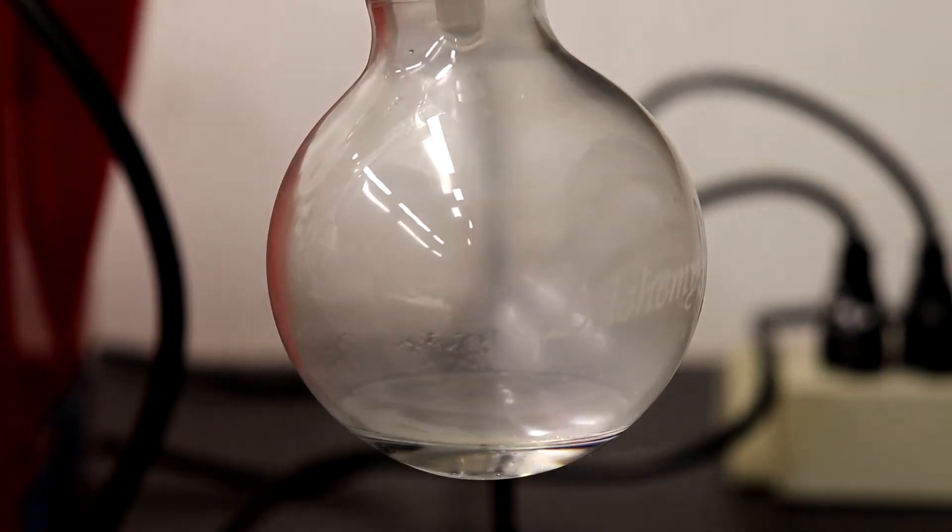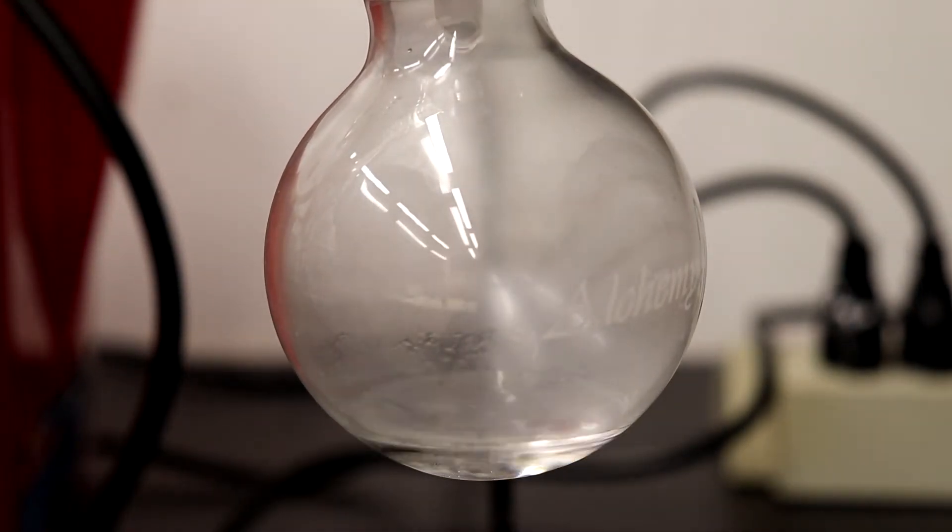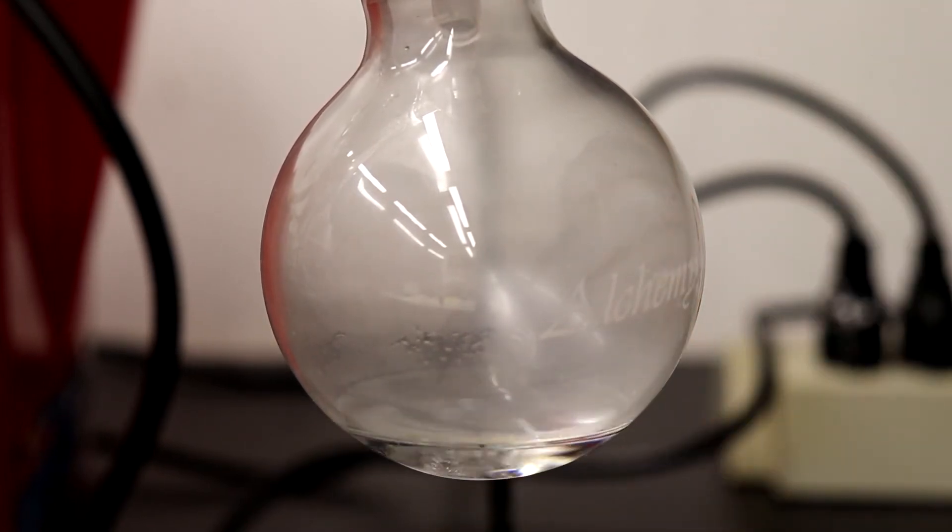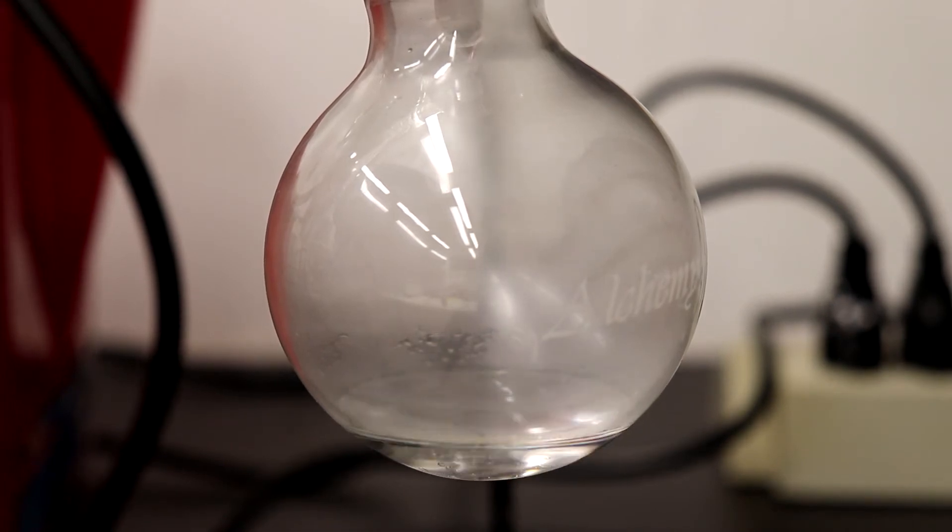So here's the drip rate of the aniline. You can see it's coming over like a couple drops a second and that's great. It's perfectly clear. It's not solidifying, so it's definitely not our starting product, which is great.